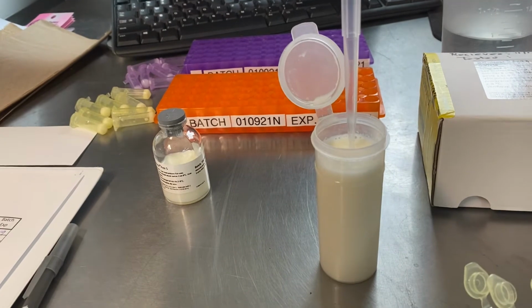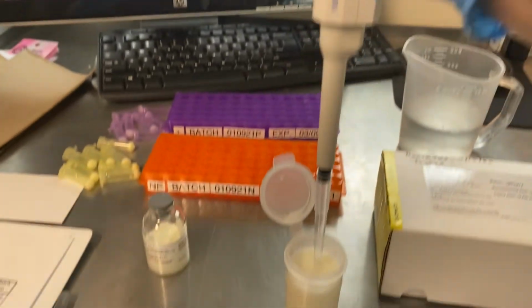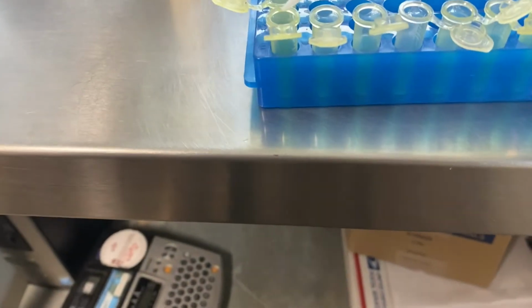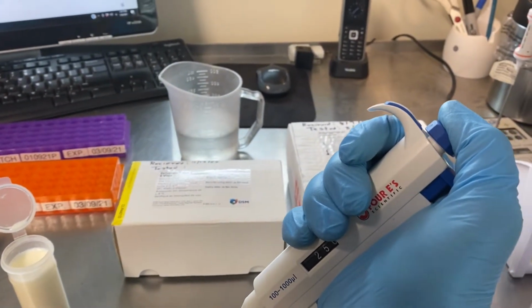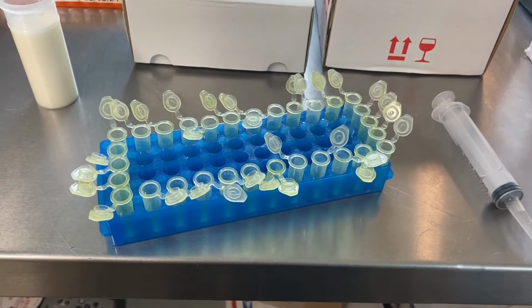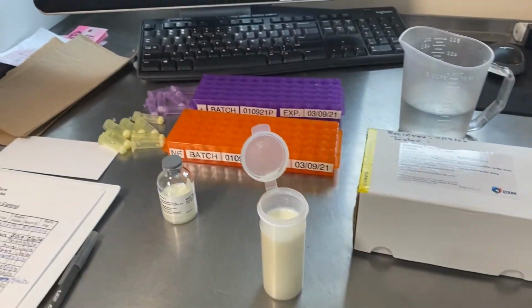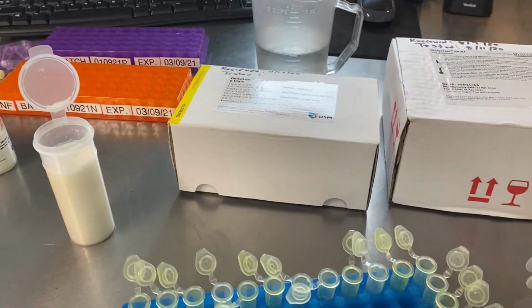Then we lower it in to about a 1/4 of an inch, and then we release. And that's now drawn up the exact amount that we want to go into our vial. Then we bring it over to our vial on an angle, and we depress it halfway and then the full way. All right, so I've filled all 30 of our sample vials with the negative control. So now all we do is we'll pop the tops back on and we'll transfer those over to our orange not found tube rack, and that's going to be ready for freezing.